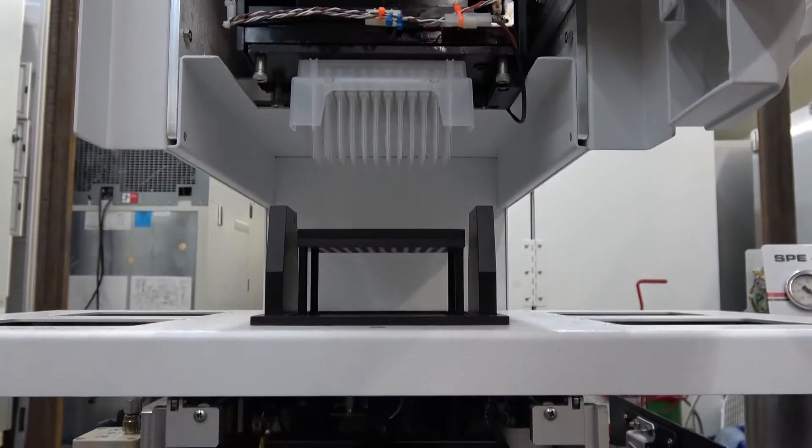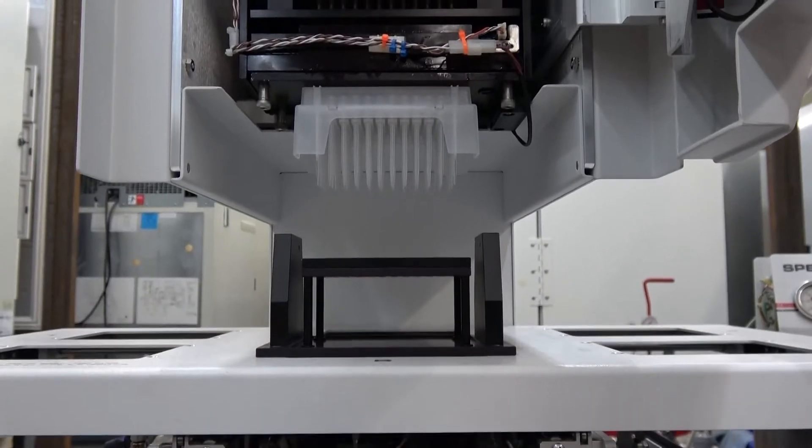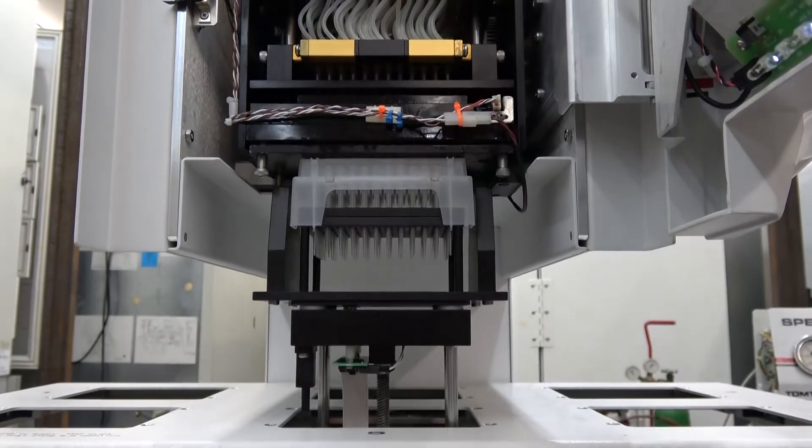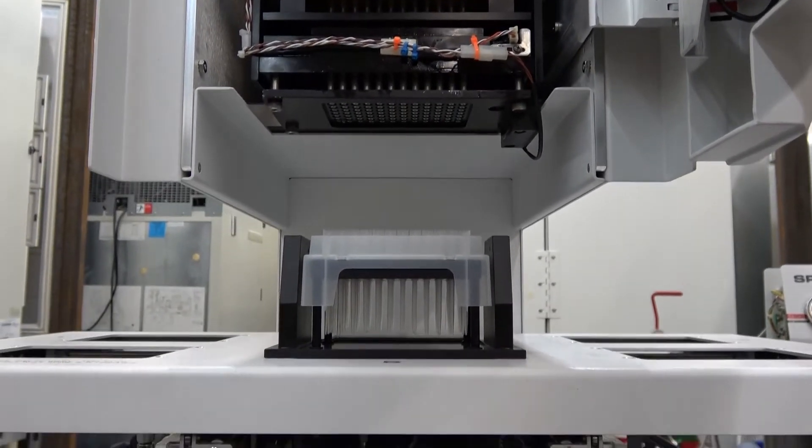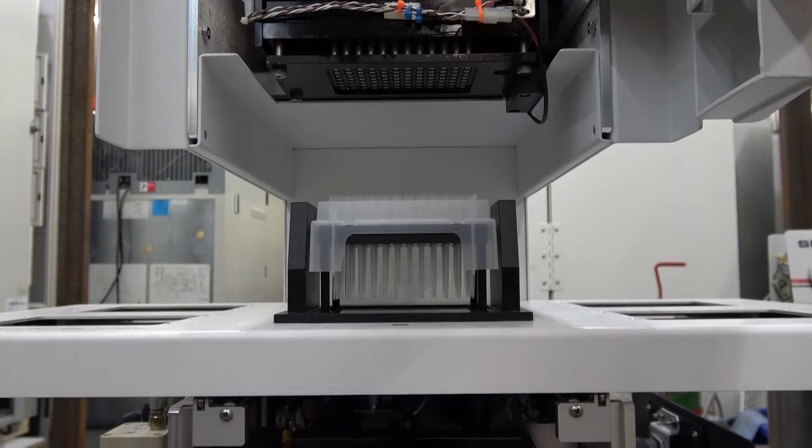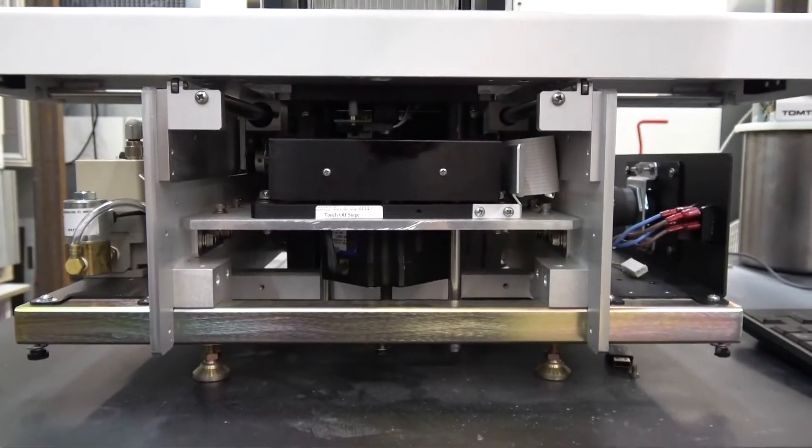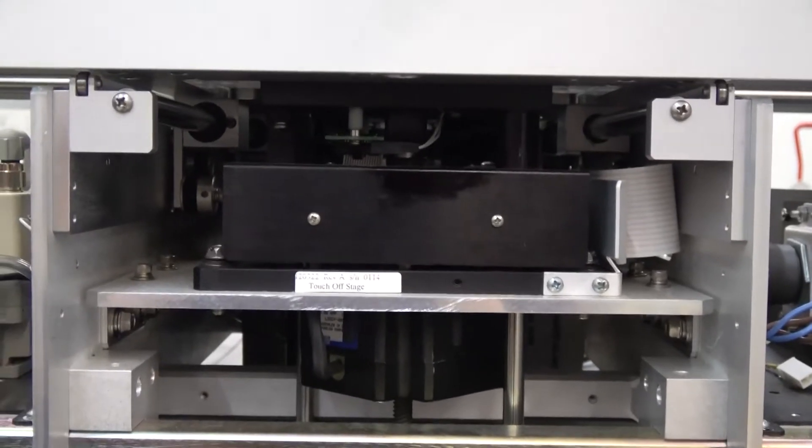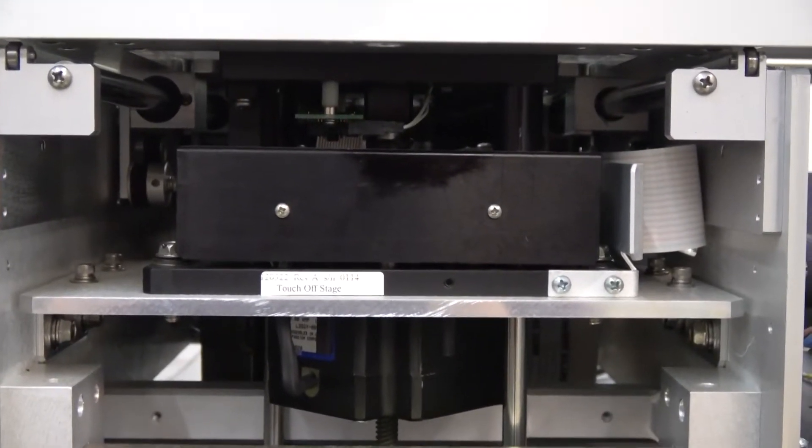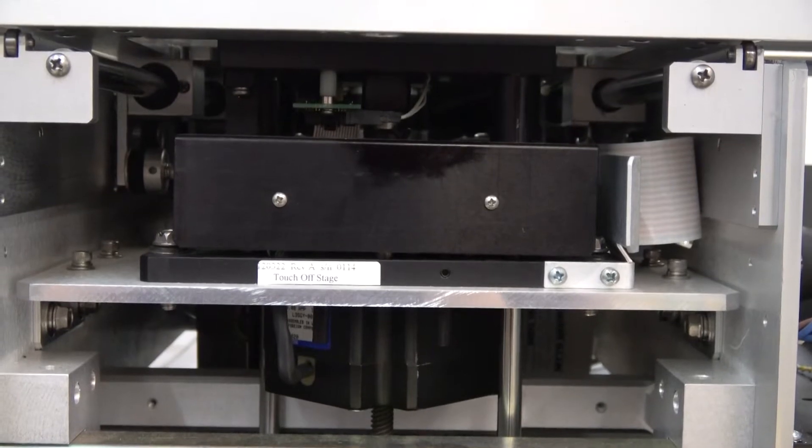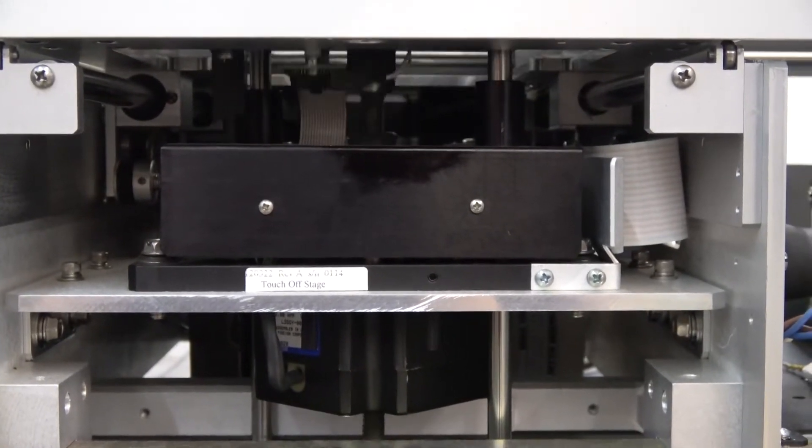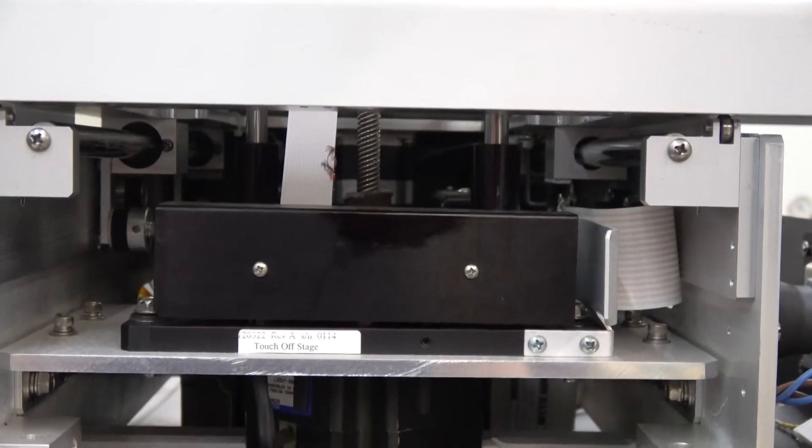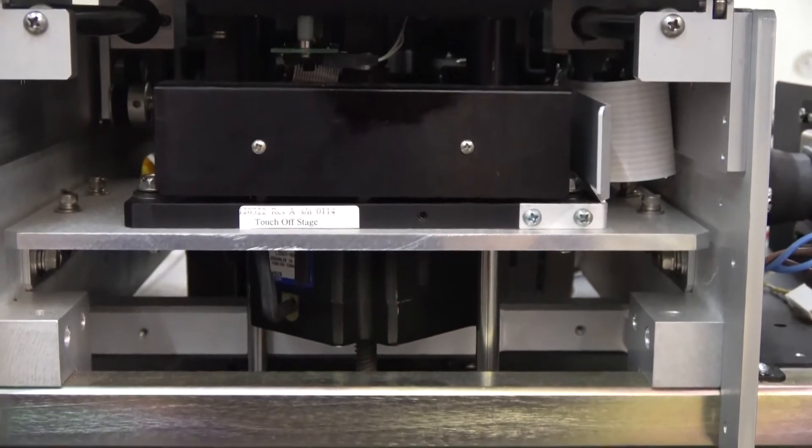Here's loading the tips, and I'm going to show shucking the tips. If you want to get a view from underneath - one more time. Now we'll show you what it looks like down here away from the pipetting head.